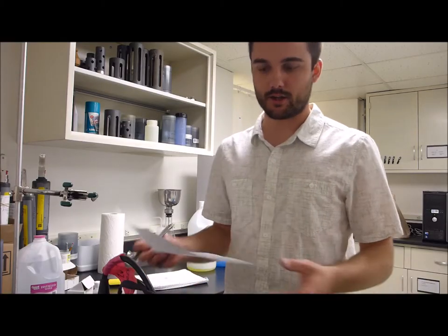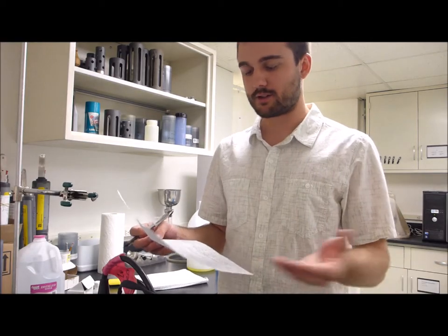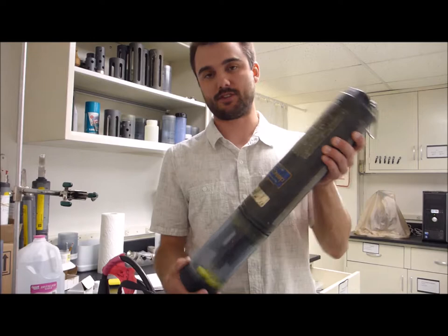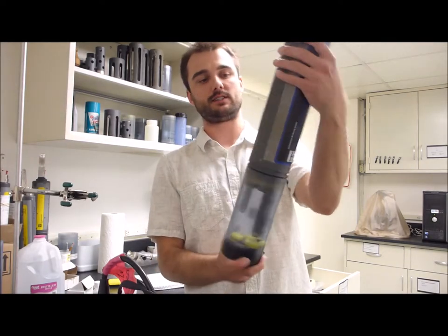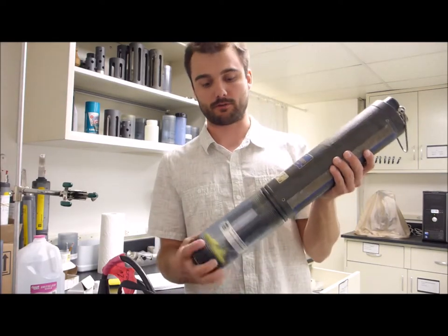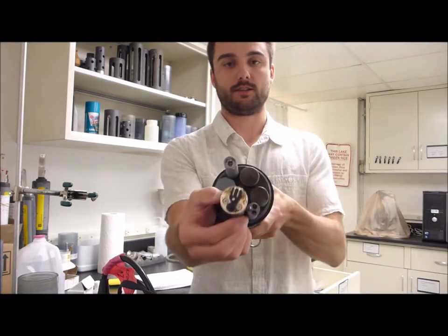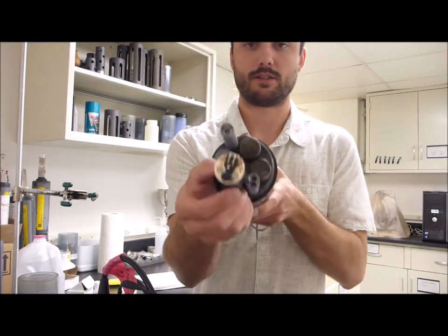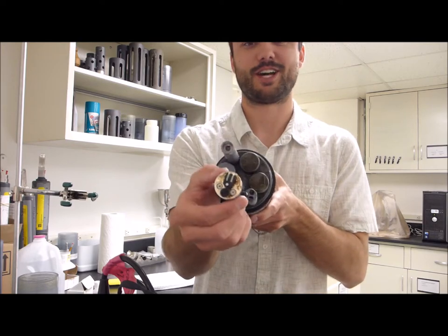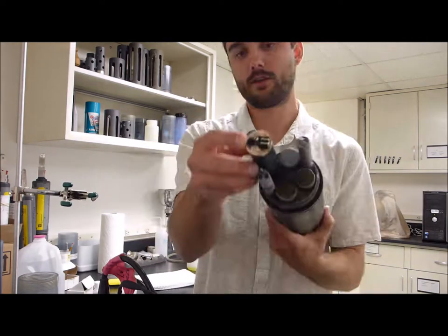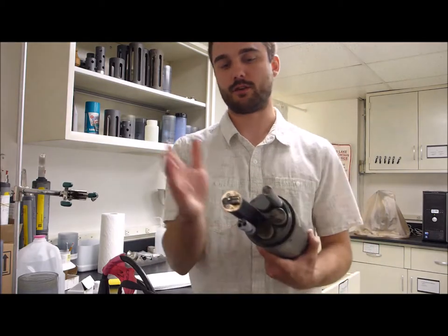Some of you may have a different type of sonde. So this is a 6600. There's a few of these being used by Riverwatch schools. The main difference on this sonde is that it has an optical dissolved oxygen probe. So there's no membrane. It has this wiper. So for this, you don't have to change a membrane. You can just calibrate this out in the field.